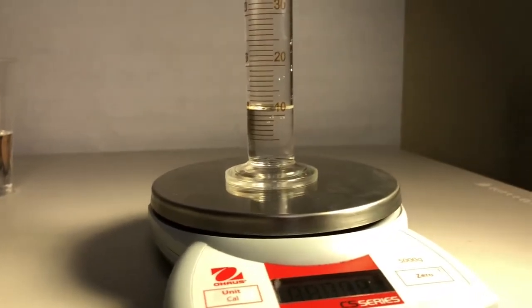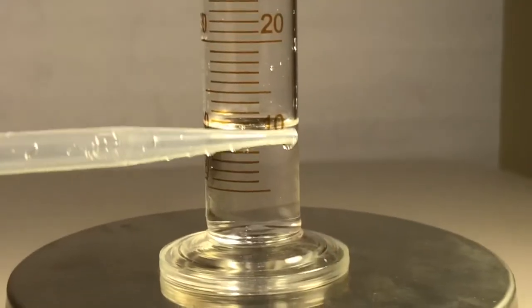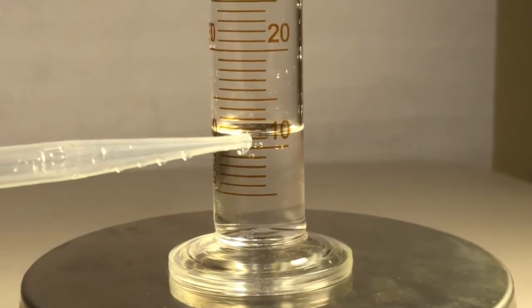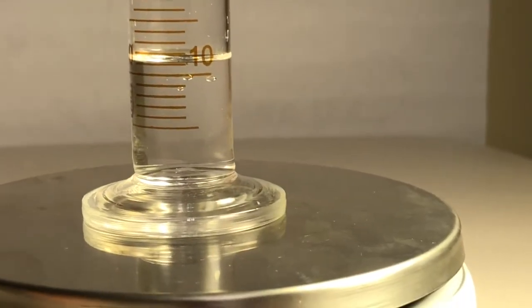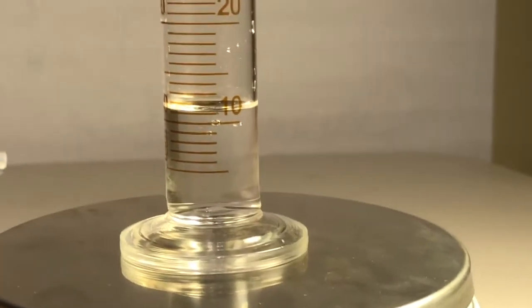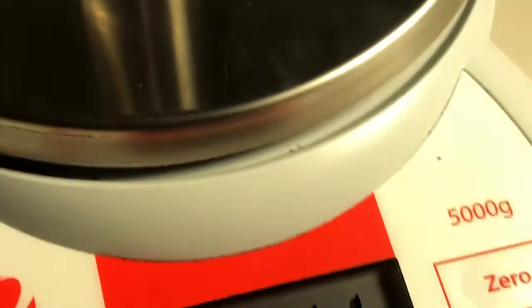What is that? Zooming in. You see that long line right there is the 10, right? And that next halfway long line is a 15, so you can count: 10, 11, 12, 13, 14, 15. So how many milliliters is that? Remember to read from the bottom of the fat line. What's that touching? Is it on a line, in the middle? You pick. Okay, and now I'm gonna show you the mass for your first data point.